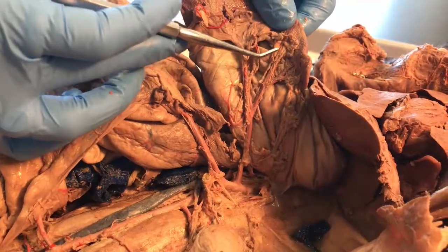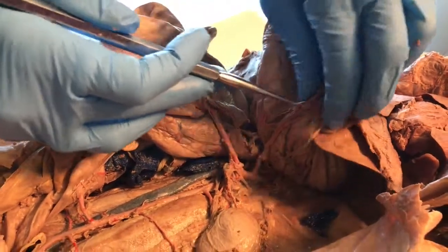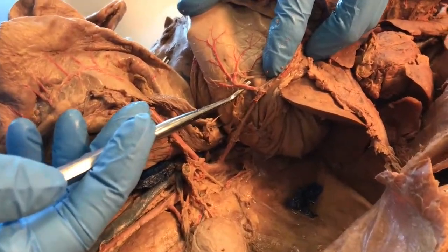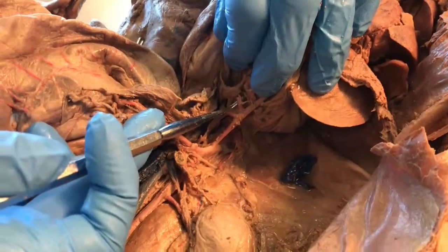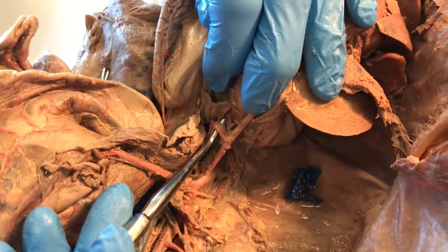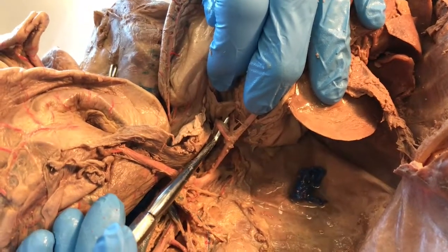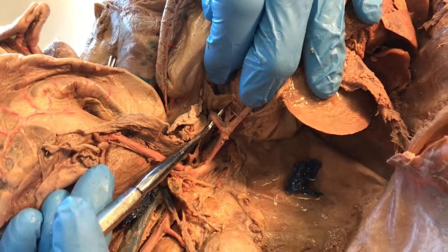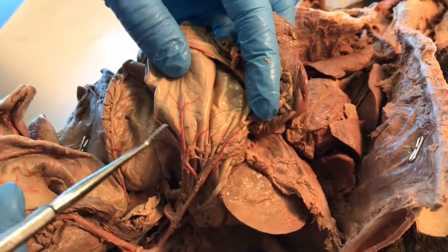If the artery goes to the organ, call it that artery. Here's a branch going to the underside of the stomach — this is a gastric artery. There's another gastric artery here. Down at the base, closest to the celiac trunk, is the hepatic artery pointing to the liver. The liver is on the right side of the body, and the hepatic artery is the very first branch off of the celiac trunk. Here is a gastric artery going to the base of the stomach.